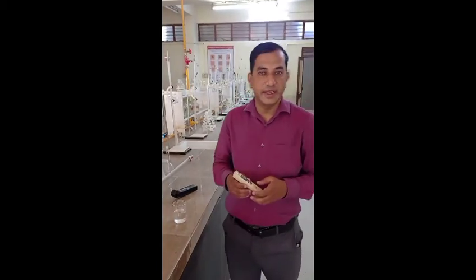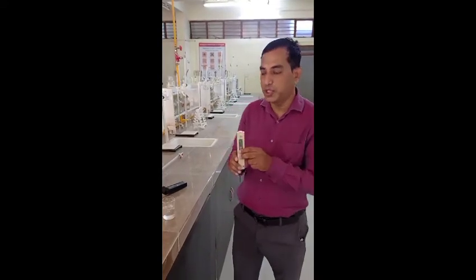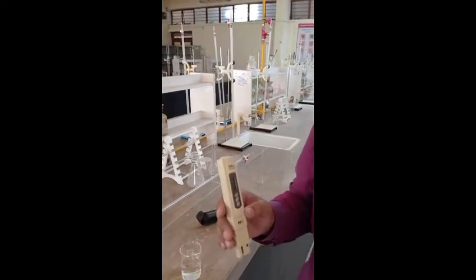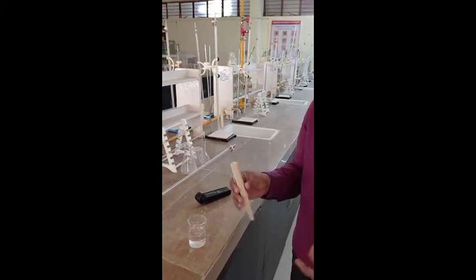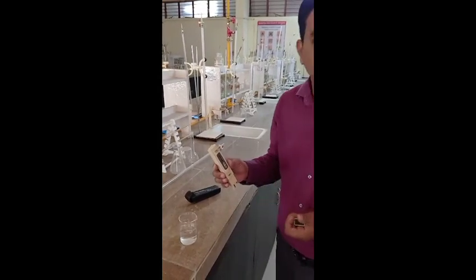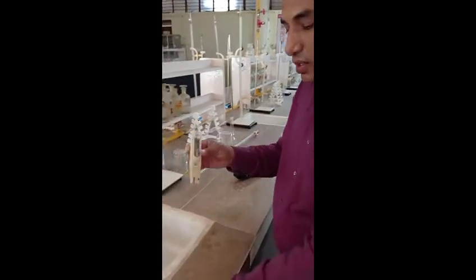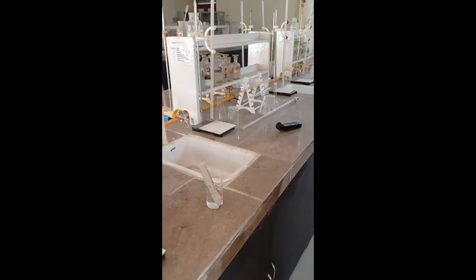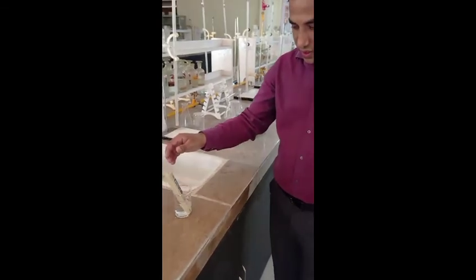Now we measure the third parameter: TDS, which stands for Total Dissolved Solids. TDS can be calculated two ways — either by measuring conductivity and then calculating TDS, but here we are using a TDS meter. This pen-type TDS meter is very simple: we just turn it on and dip it into the water for three to four seconds to get the TDS reading. Here we put the TDS meter into the water sample, and the TDS is around 660 ppm.